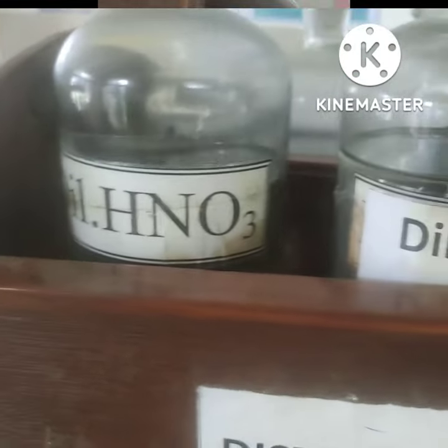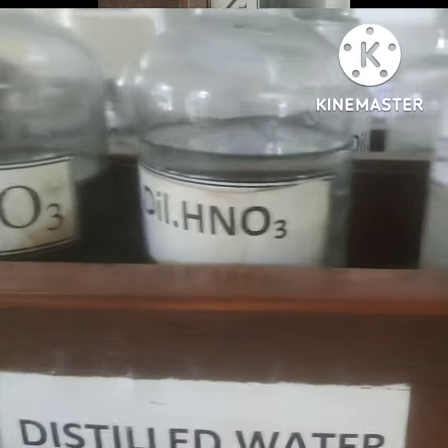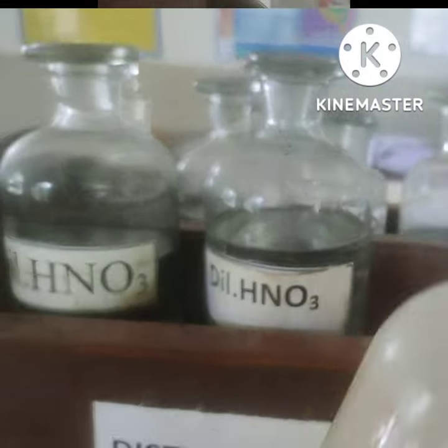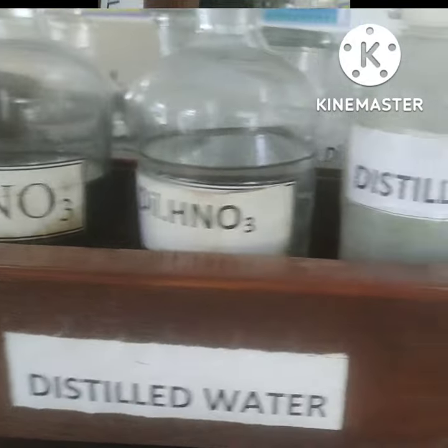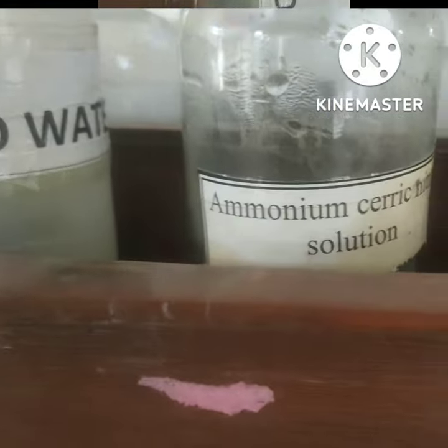HNO3 is again nitric acid. Distilled water.